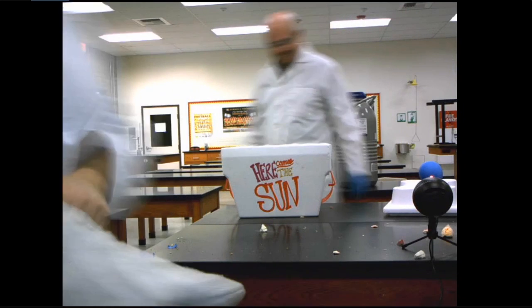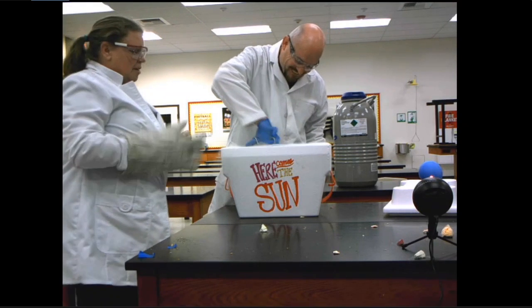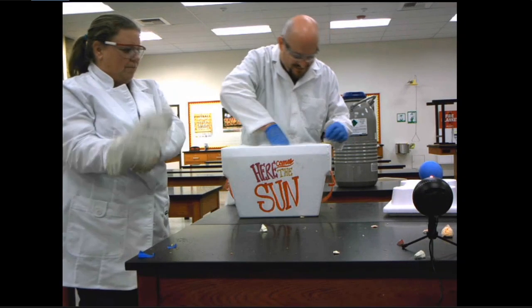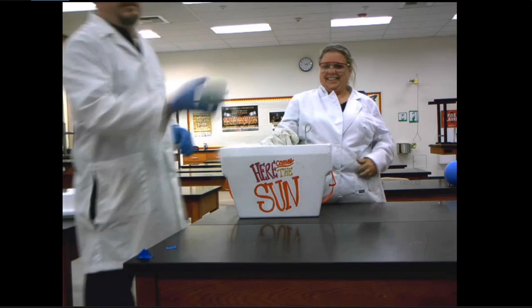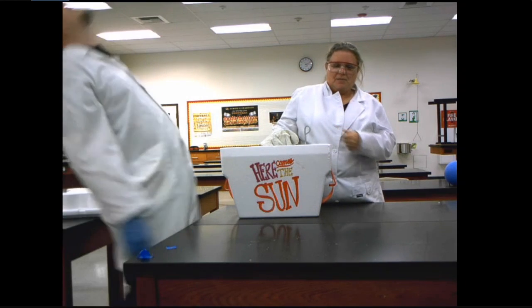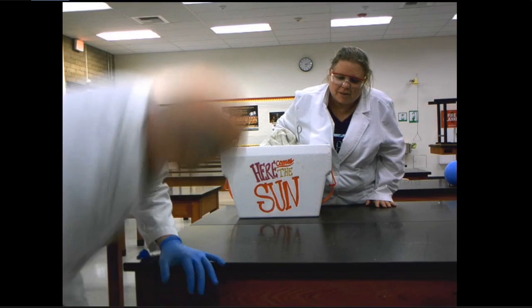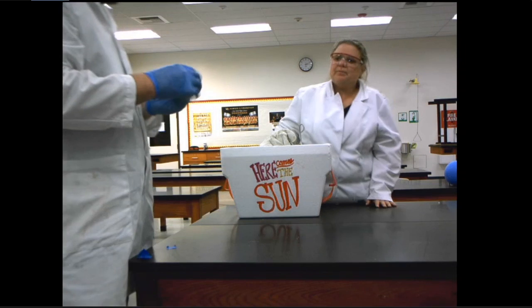That's the apple. Wow. So that's what liquid nitrogen dropping that temperature does. Tennis ball. Ready. Stuff came out. Look at liquid water all over the table. Or liquid air.